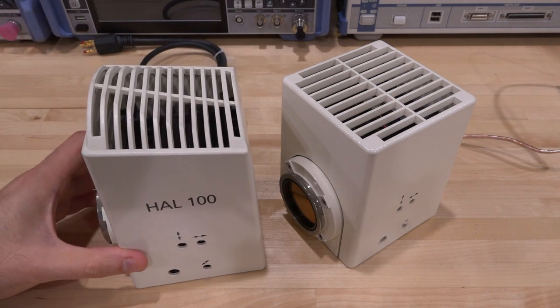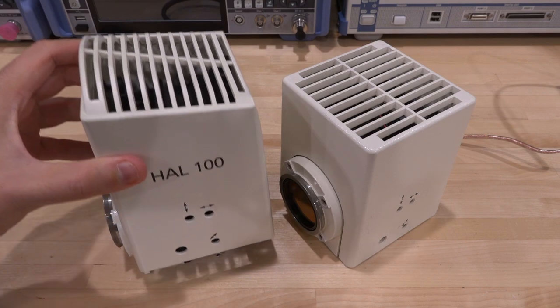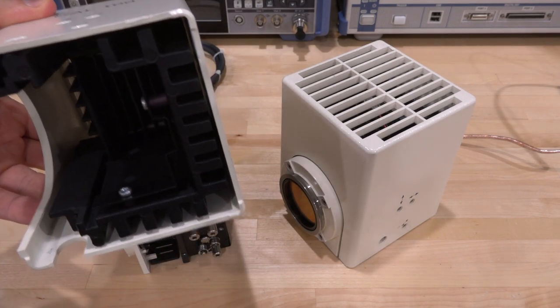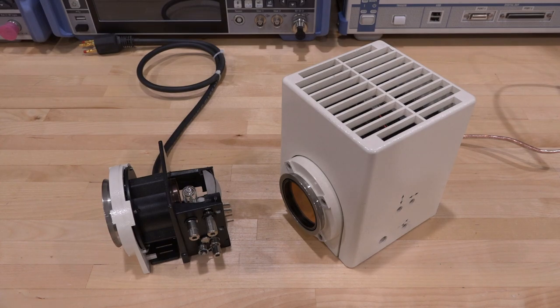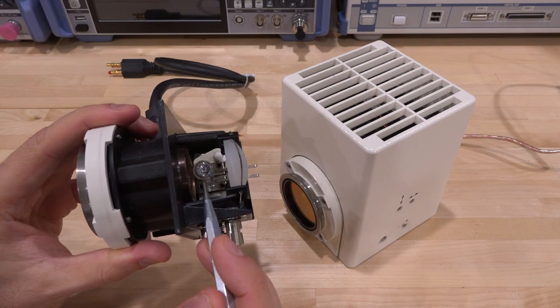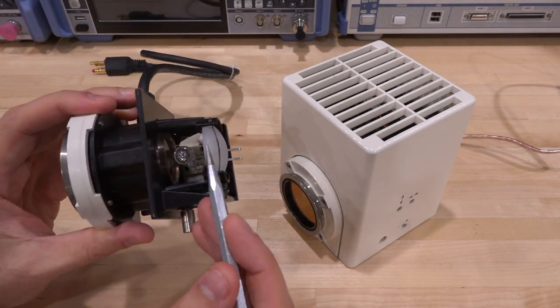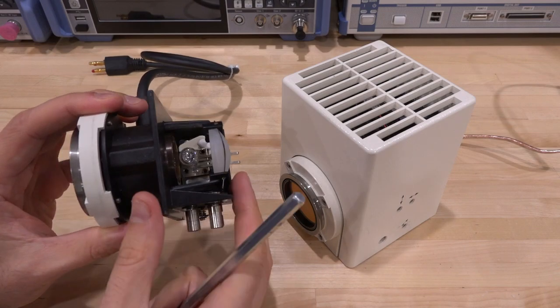So this is what a normal halogen-based lamp looks like. This is the HAL 100, and this is a 100-watt lamp. And if I open it, you can see there's a big heat sink in here, unsurprisingly, because this thing does produce a tremendous amount of heat. And inside of it, you can see we find one halogen lamp. And the lamp has a mirror in one side. It's a reflective mirror. It gets as much of the energy forward as possible through this aperture.